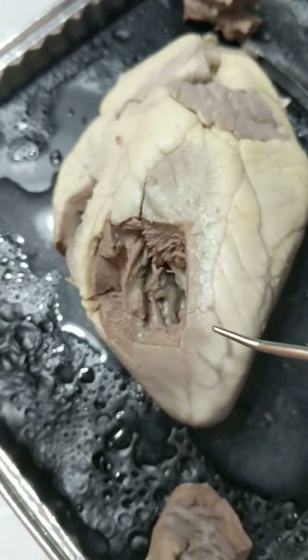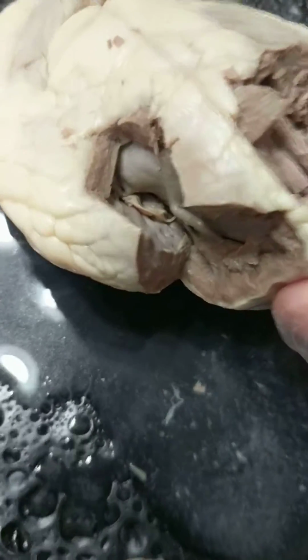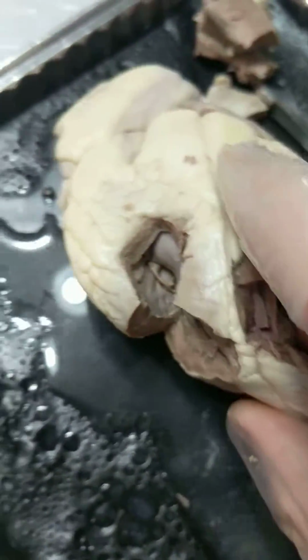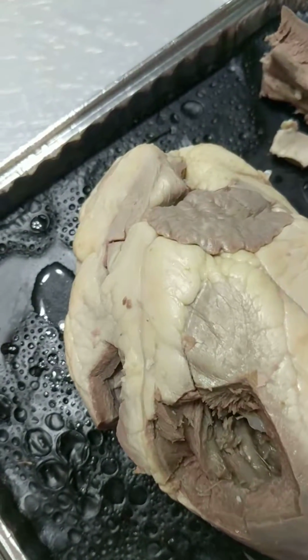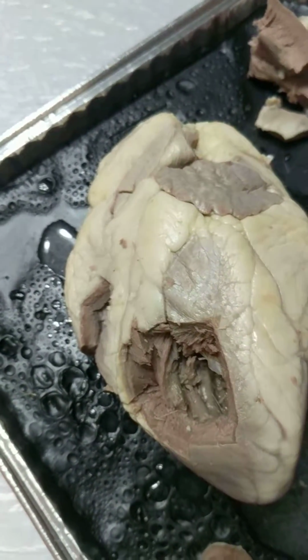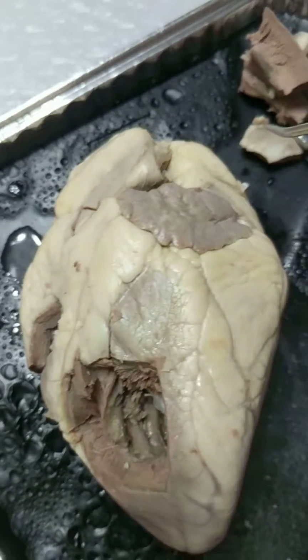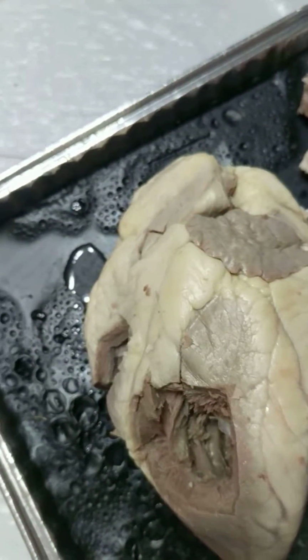The chordae tendineae, we were able to see a couple of those. Actually, if I can hold this well, you can see a couple of them right there in about the middle. That's actually a cut one. Those are the fibrous cords that connect the valves with the papillary muscles. The coronary artery is the artery that actually supplies blood back to the heart. Tough to tell here because it would normally wrap back onto itself.